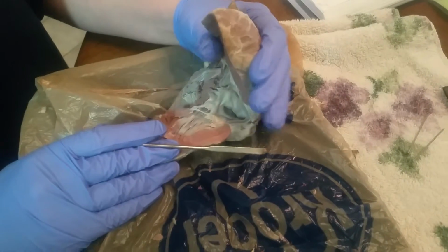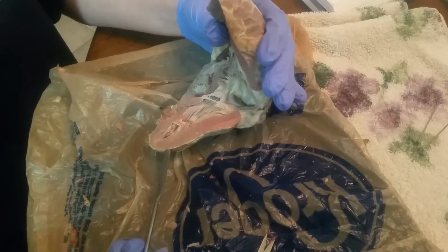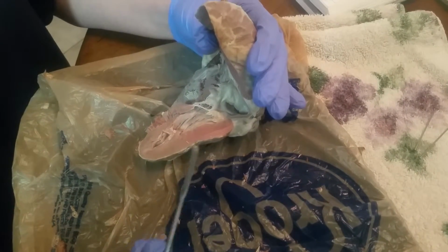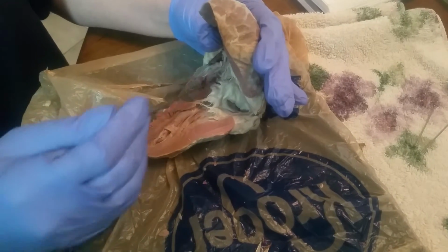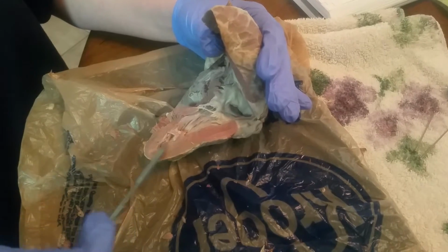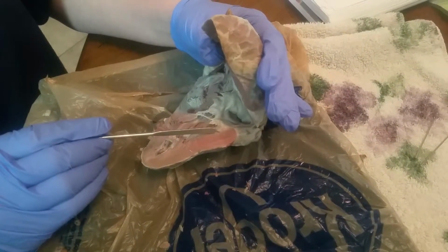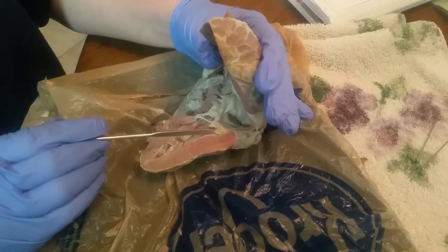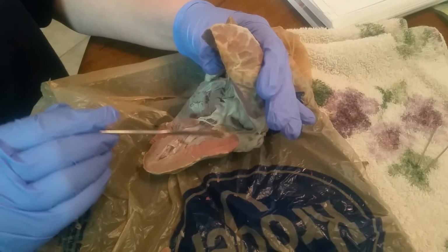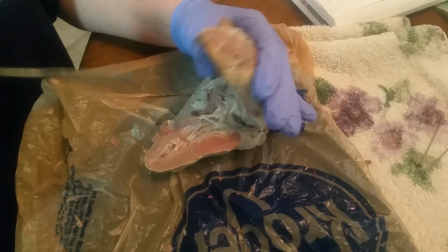And then to do our epicardium, it's going to be this white little thin layer, the first layer of the heart. Epicardium. Then we have our myocardium, which is made up of the septum, myocardium, it's this area right here. And then we have the endocardium, that is going to be this thin little layer right here, where the papillary muscles connect right after the myocardium muscle. And that is it for our heart.